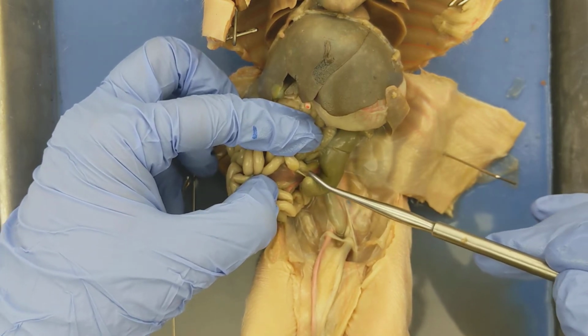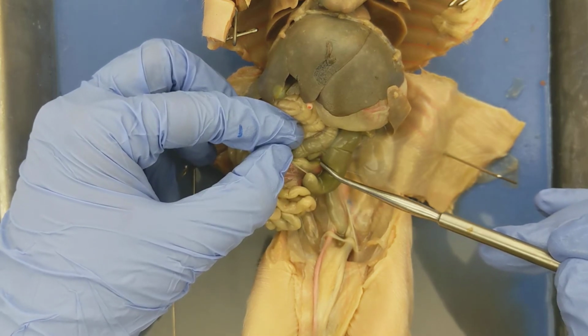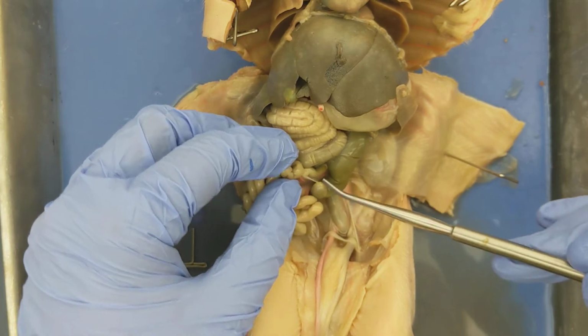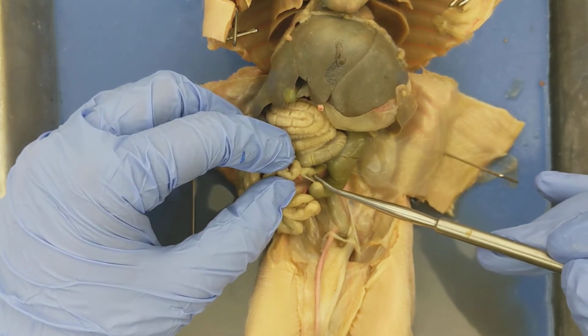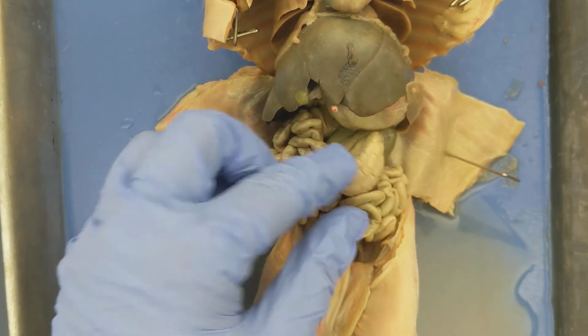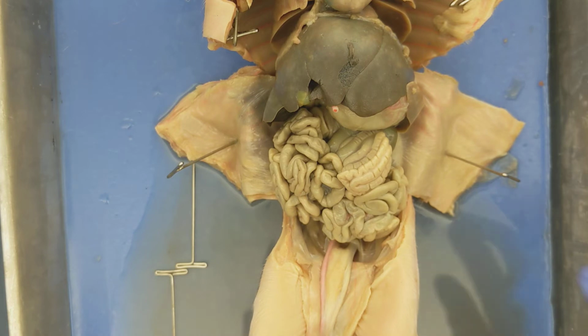This is the cecum. And the small intestine, you might be able to see it here, feeds into this pouch of the large intestines, meaning the food that's being digested in the small intestines enters into the cecum, and then from the cecum it travels throughout the large intestines. Another name for the large intestines is the colon, right?